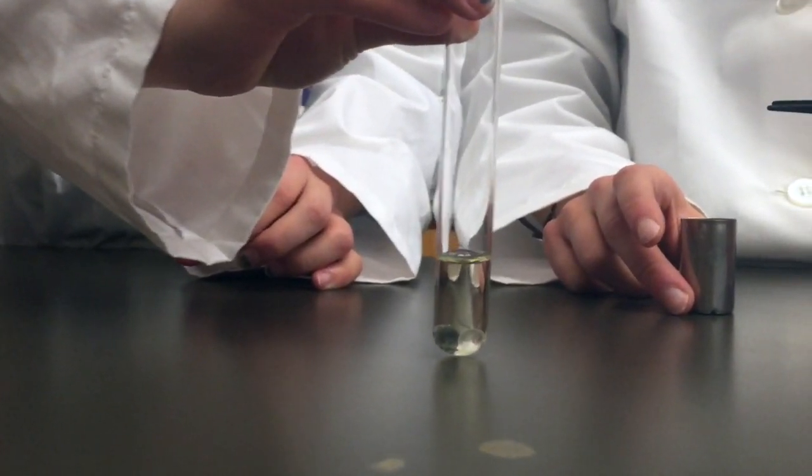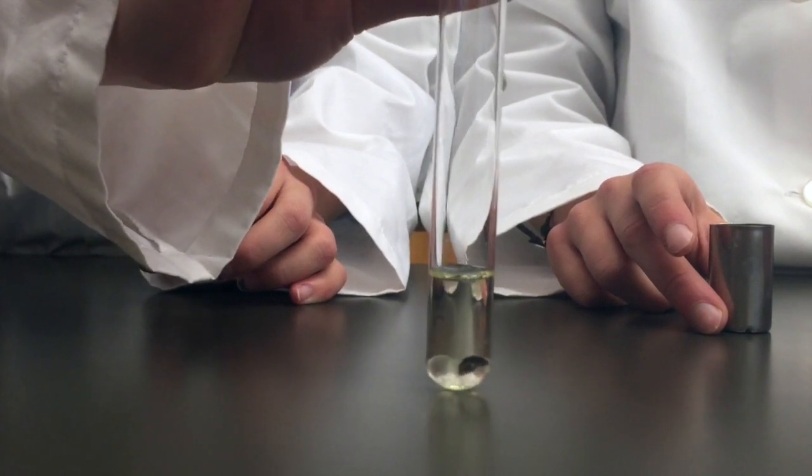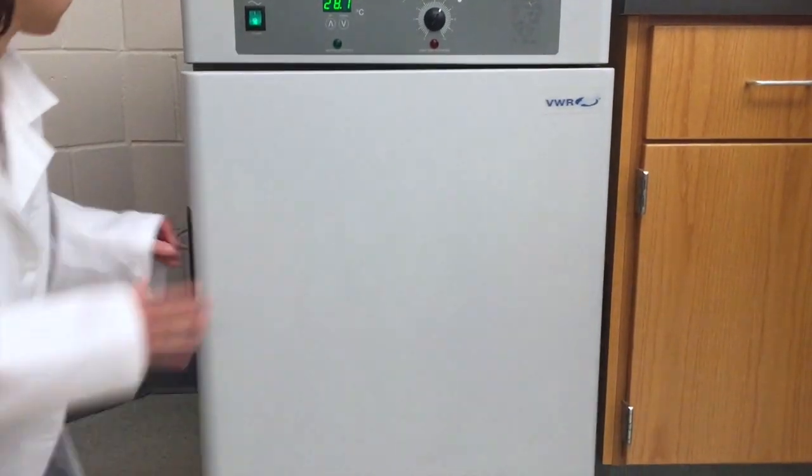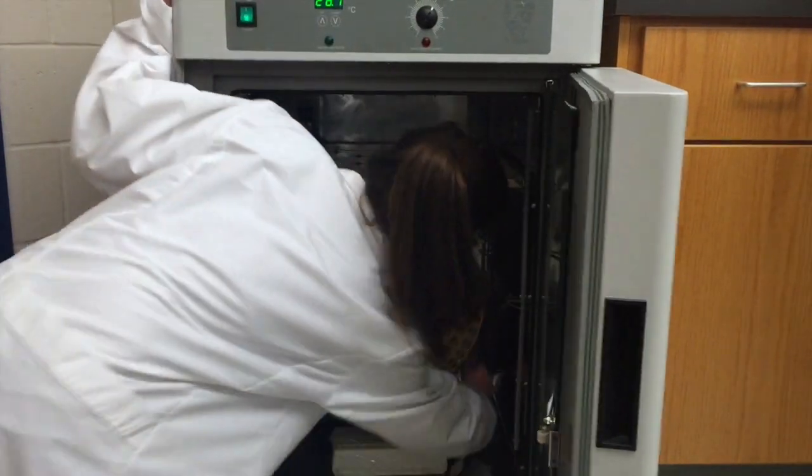For example, if you remove a white bead, ensure that you are placing it into a test tube containing fresh media and a black bead. The new evolution tube will then be placed back on the roller drum in the incubator and allowed to grow for 24 hours.